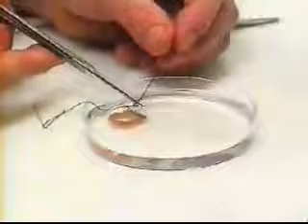For this reason, the needle is always inserted from the lumen outwards. Methods of attachment to the tissue holder will vary, but in this case a short loop is formed in the first ligature and secured with a double knot. The free ends of the ligature are then trimmed, whereas in other cases these may be left long.